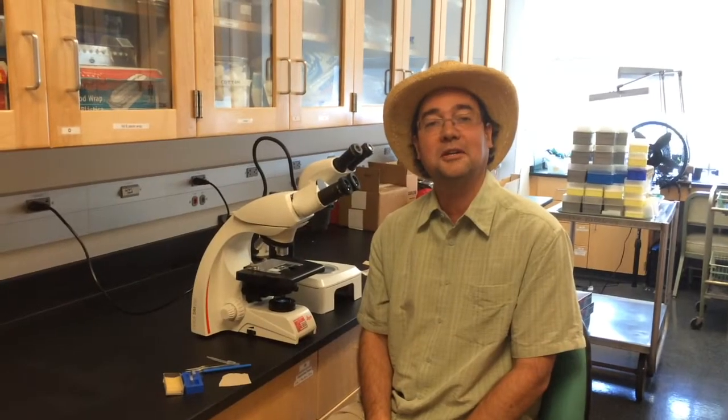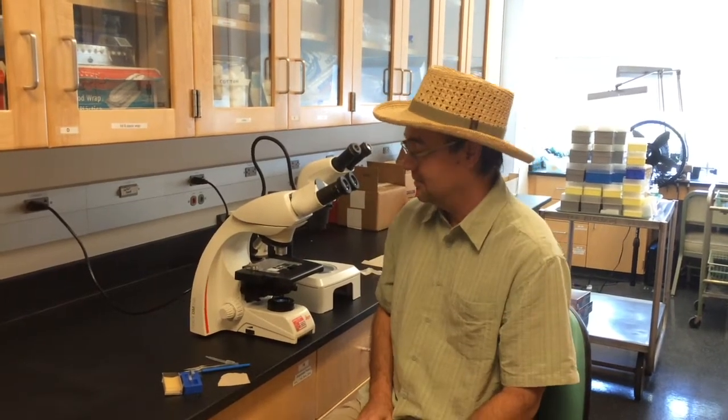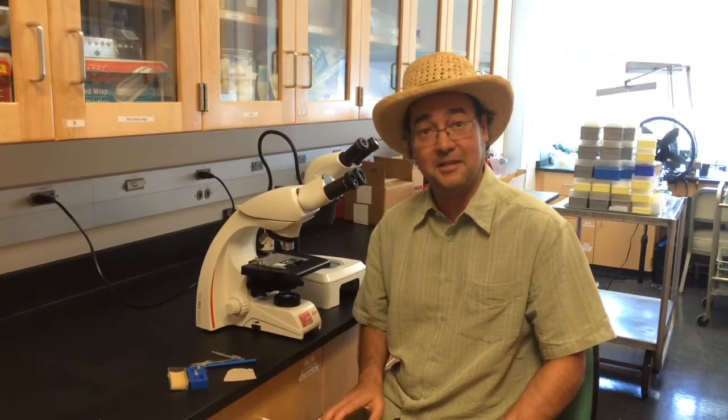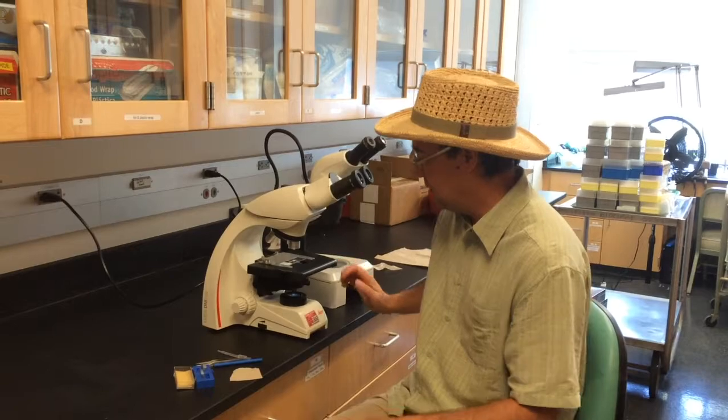Hello, students. Chimichanga here. And I'm noticing many of you don't use the microscope correctly, so I want to fix that. So here we go.